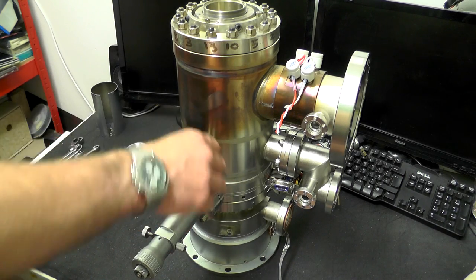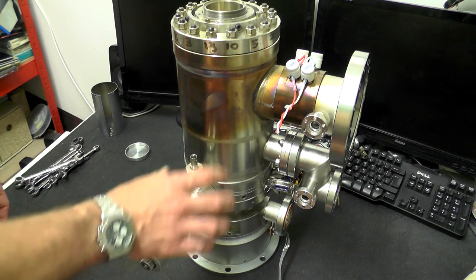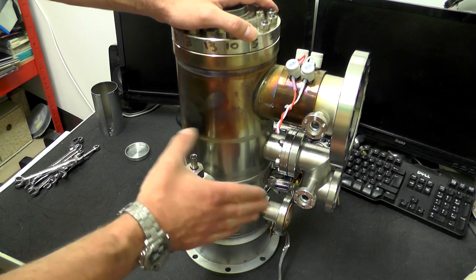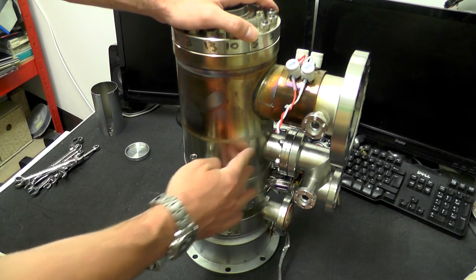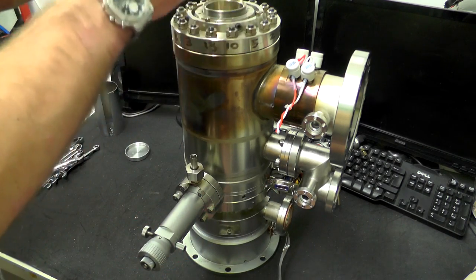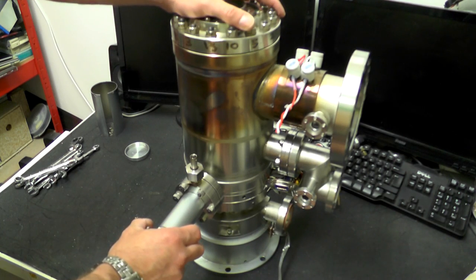This connection here I think is a beam monitor — as this is inserted into the beam, it picks up the actual strength of the beam, the beam current. Just down here we have a connection and a number of wires running into the actual column. These will be for the focusing lens coil, and also for the stigmatism control coils, because the beam that comes off the electron gun isn't perfect and you have to squash it in various directions to get the best quality beam possible.